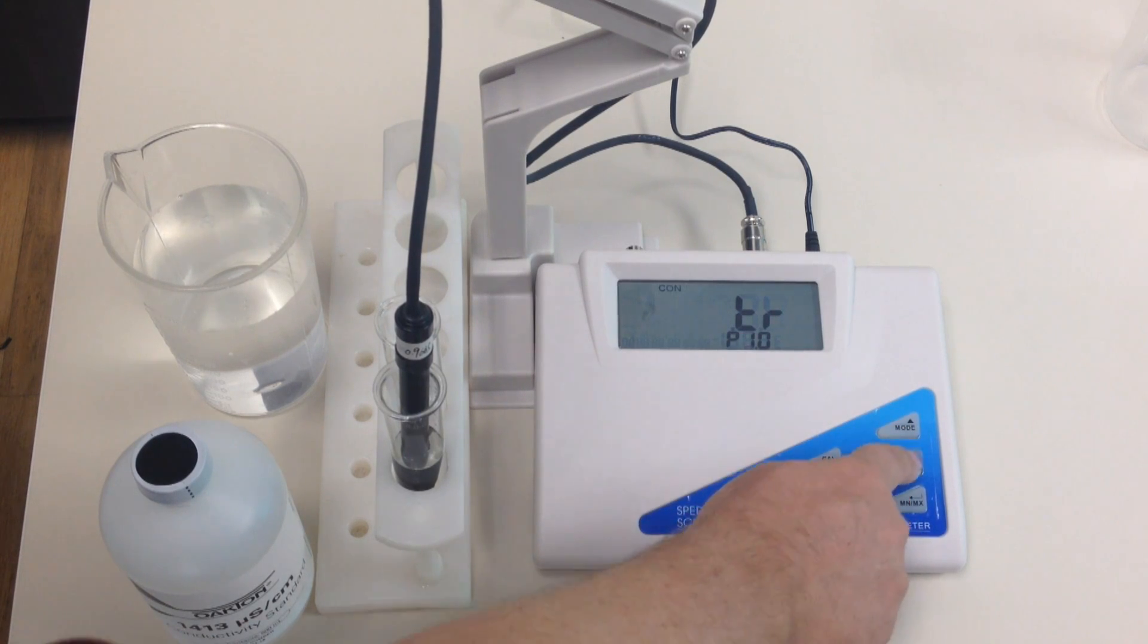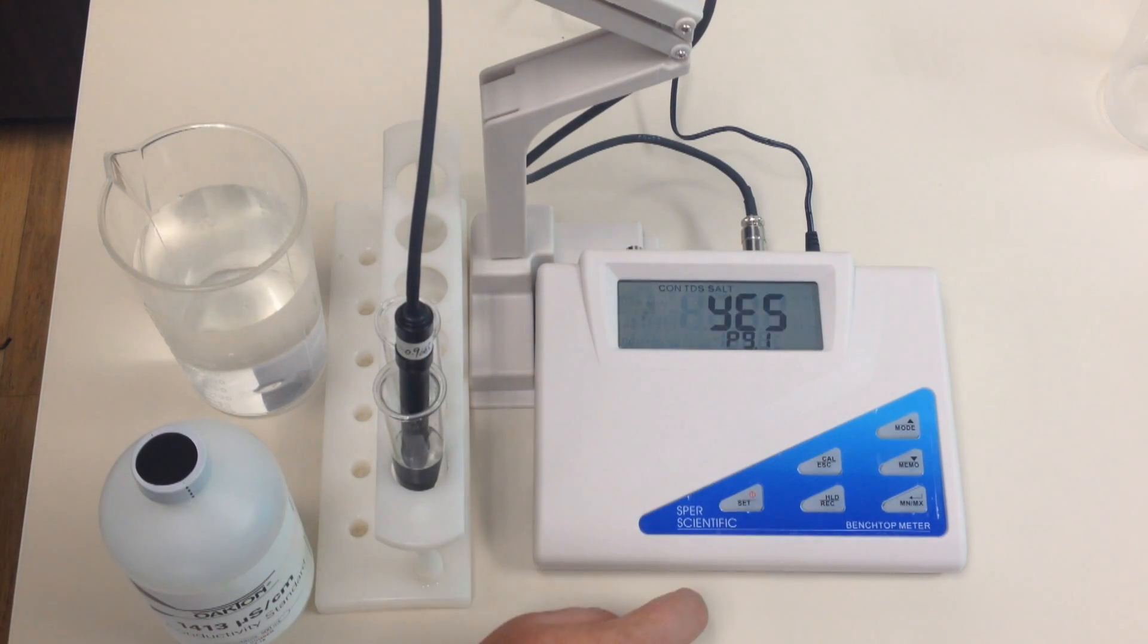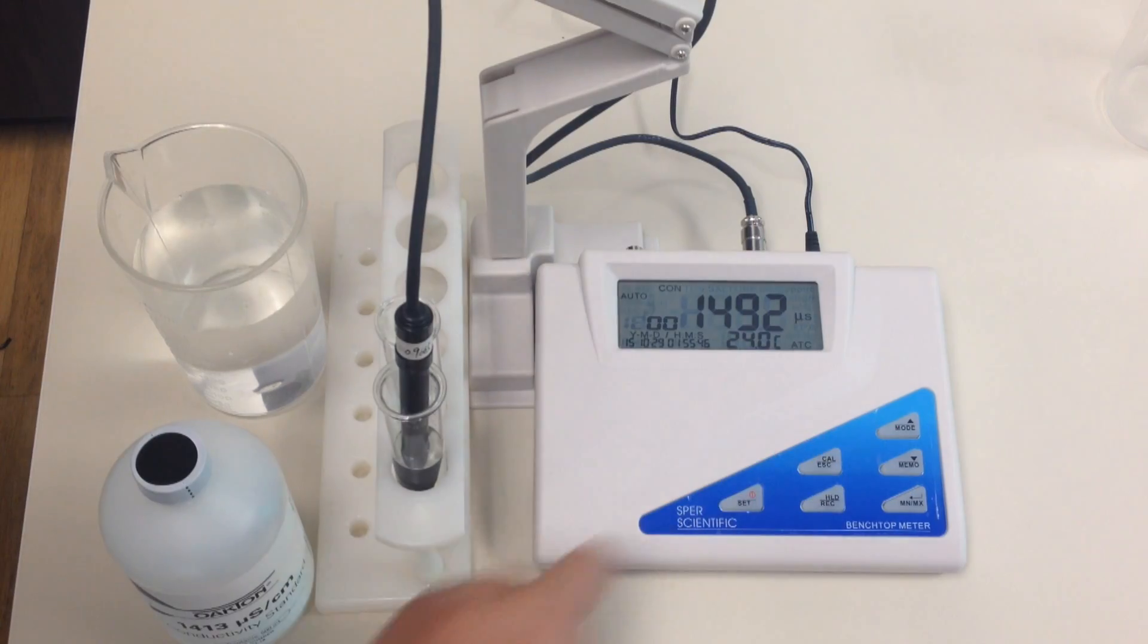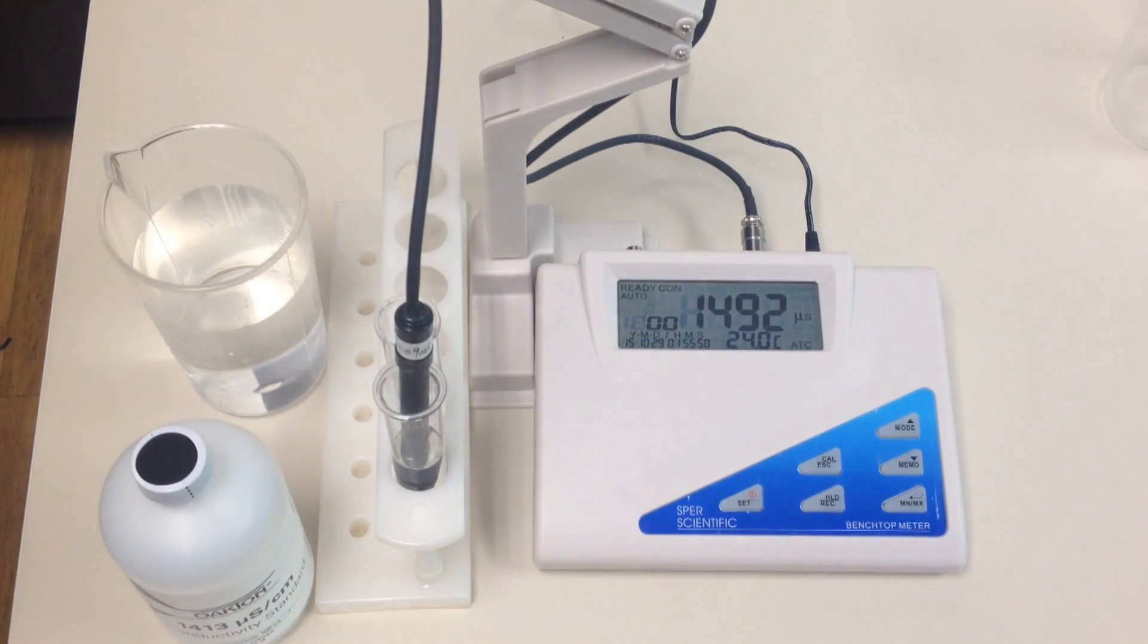Reset, say I went too far, I can go back to it just like before. I'm going to hit min-max, it's going to ask yes or no. I want to hit yes, I want to hit min-max, or the little confirmation button that you would see. It's going to now reset, hit escape, and I'm back to factory settings, as you can tell by the unit going to there.